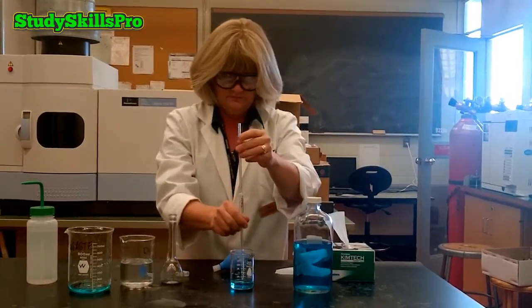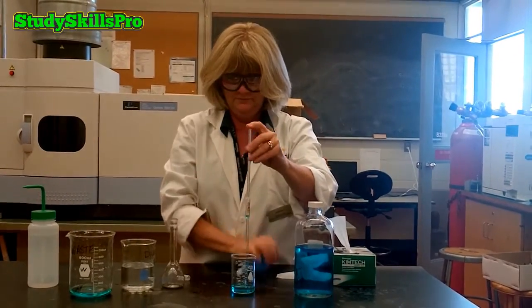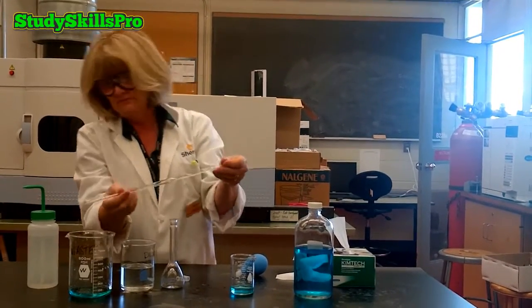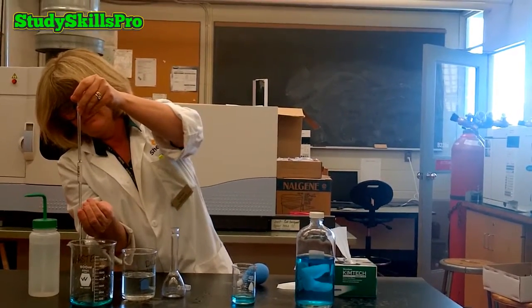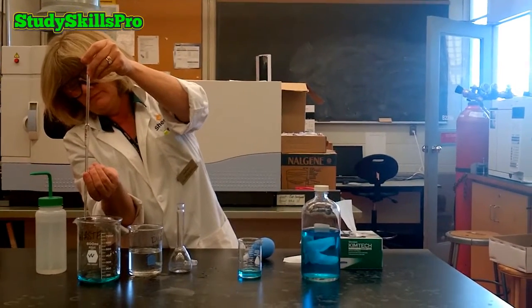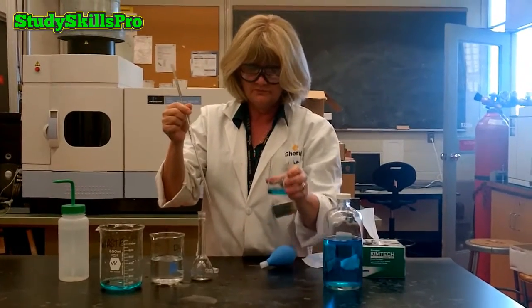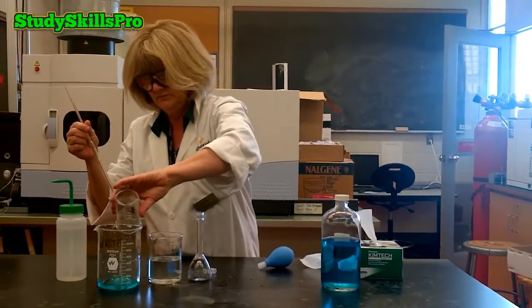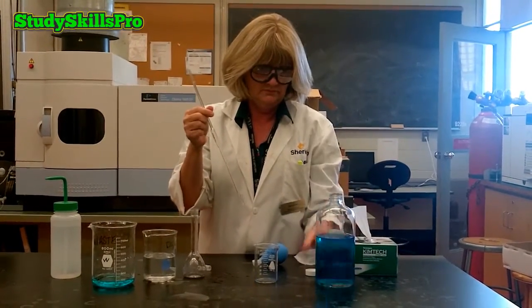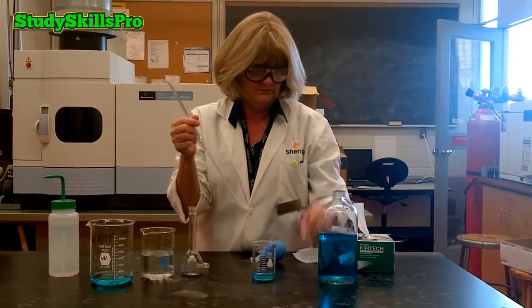And while you are rinsing, it is good practice to rotate your volumetric pipette and invert back and forth a few times in order to ensure that all surfaces of the volumetric pipette have been analytically rinsed. Once your pipette is rinsed, you are now ready to transfer the stock solution to the volumetric flask. It is always good practice to pour out your stock solution from the beaker and add fresh stock solution to your beaker to pipette.